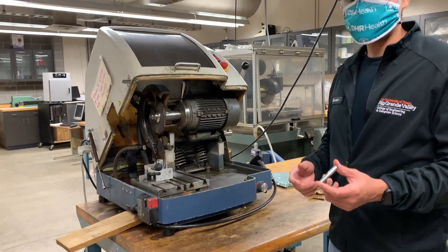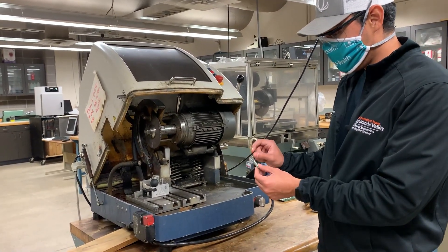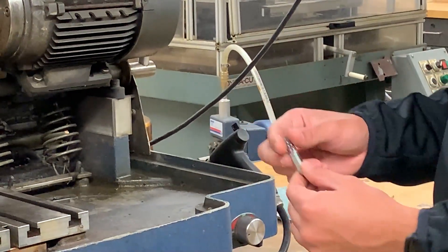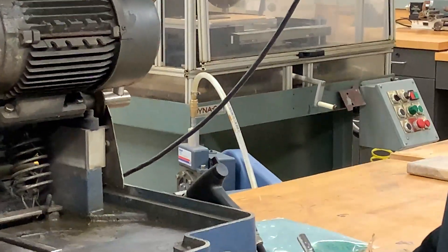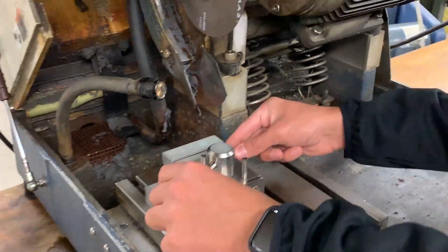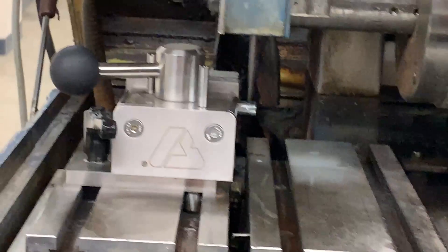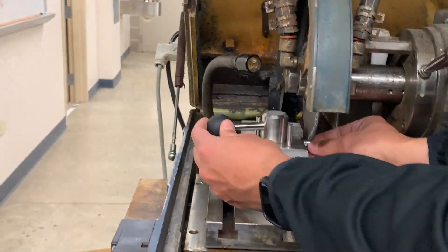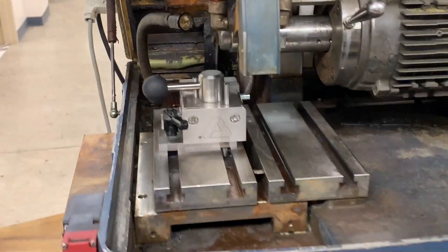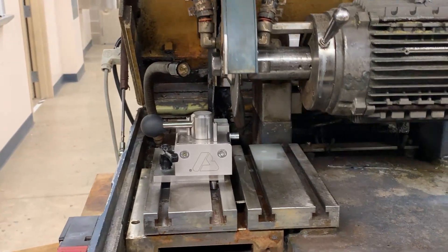We need to prep our samples before placing them in the mounting press. We need to take out a small section — about a quarter of an inch — off each of the two bolts. We're going to place them in the clamp and make sure they're clamped down all the way. We need to verify just how much of a piece we need, so I'm going to adjust it to the length required and clamp it down, verifying it's approximately a quarter of an inch.